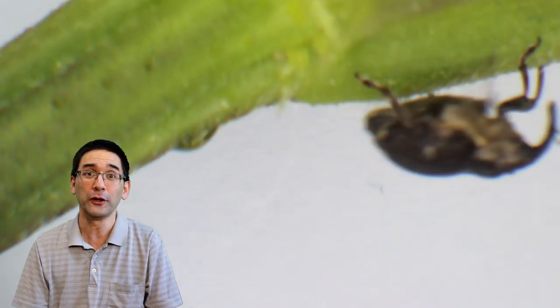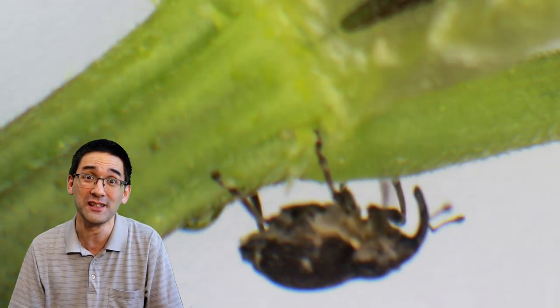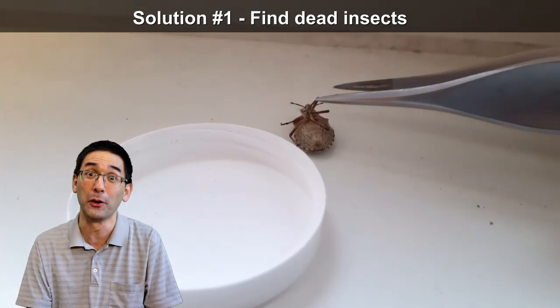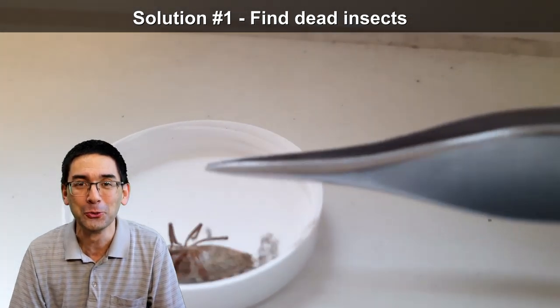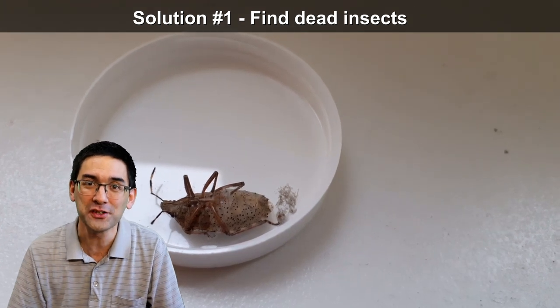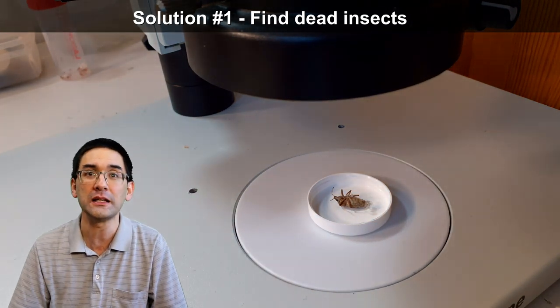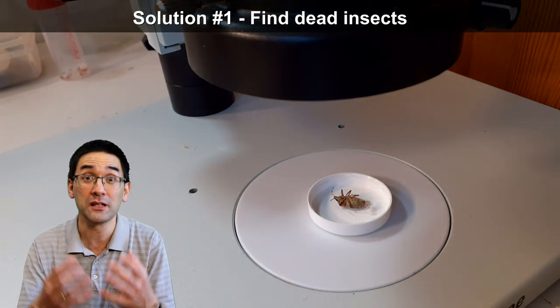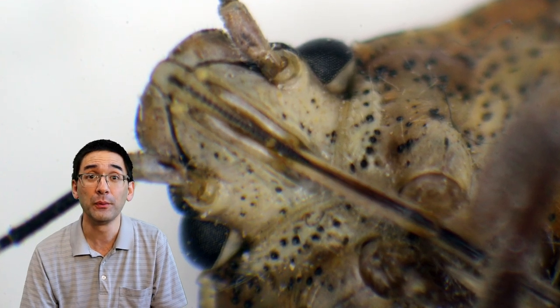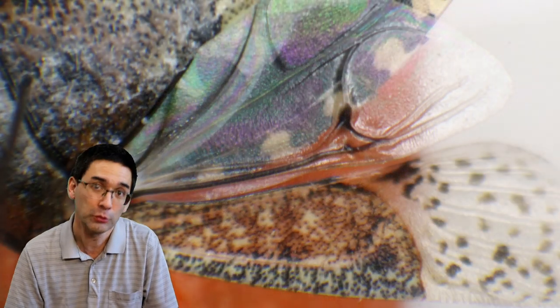The first and easiest way to observe insects is to simply find dead insects somewhere in your house or apartment. Sometimes it's good not to be too clean, because then you might find some of these dead insects lying around, and they can be easily observed under the stereo microscope. In many cases the results are quite acceptable.